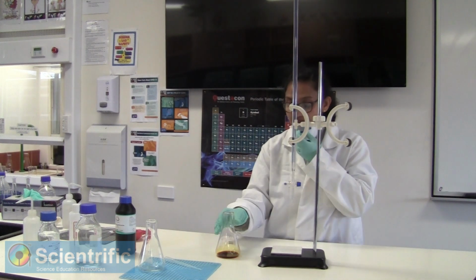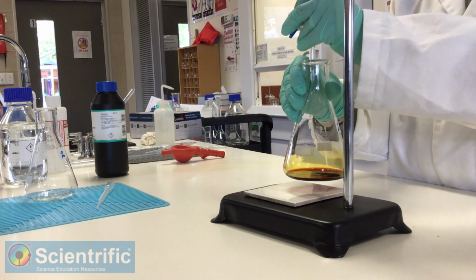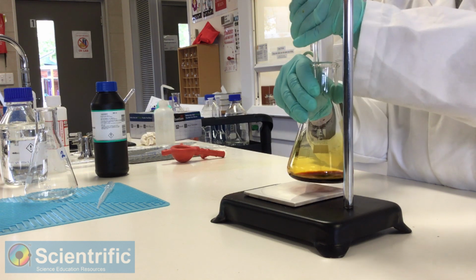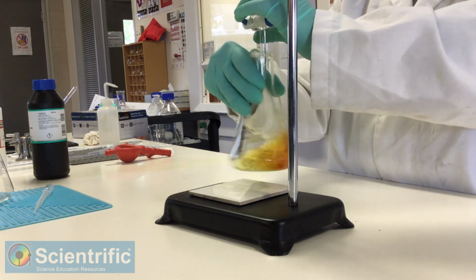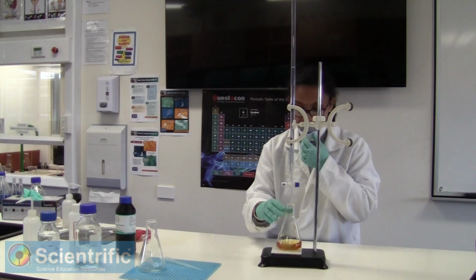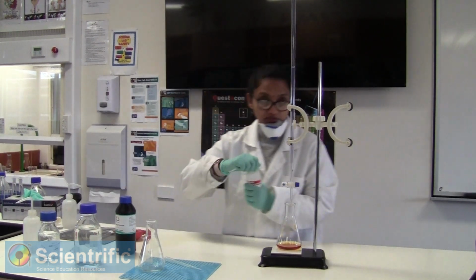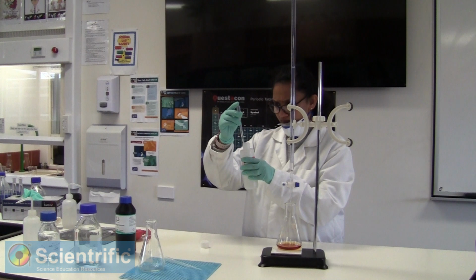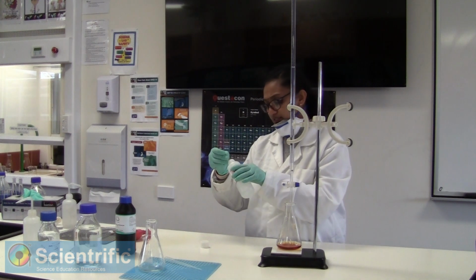So we're starting at 0. Being very mindful of this iodine being released here. Okay, so it's getting nearly that pale yellow color. So we add our starch solution to it now. Adding the exact same amount of your starch solution again. So it's around 2 mils. That's what the method is suggesting.